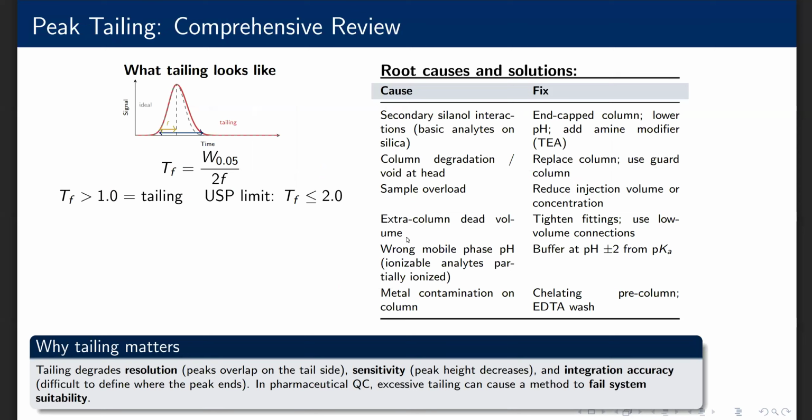The diagram shows a tailing peak in red compared to an ideal Gaussian dashed in gray. The front edge is sharp, but the back edge decays slowly. The tailing factor TF is measured at 5% of the peak height. It is the total width W at 5% divided by twice the front half width F. A perfectly symmetric peak gives a TF of 1.0. USP requires a TF of 2.0 or less.